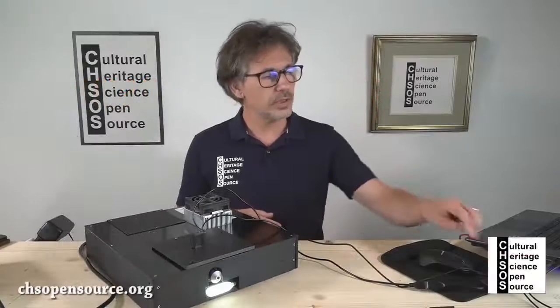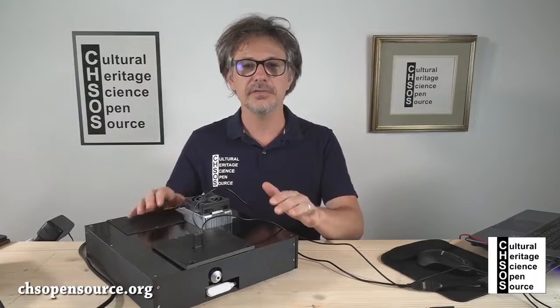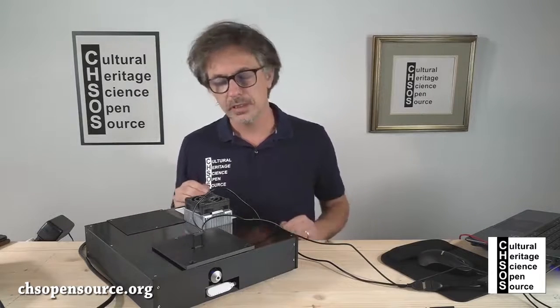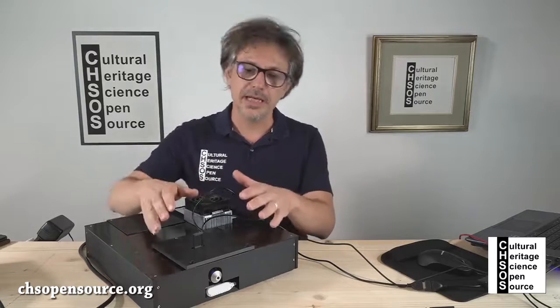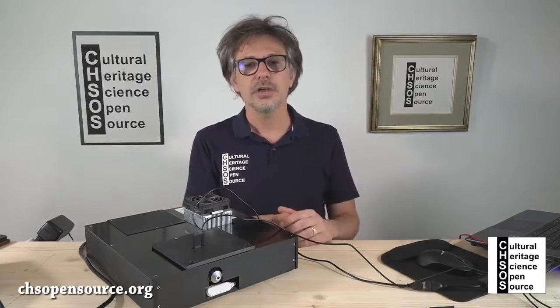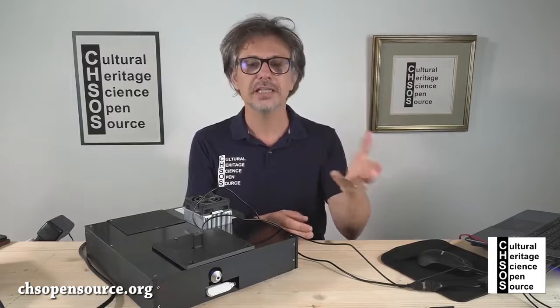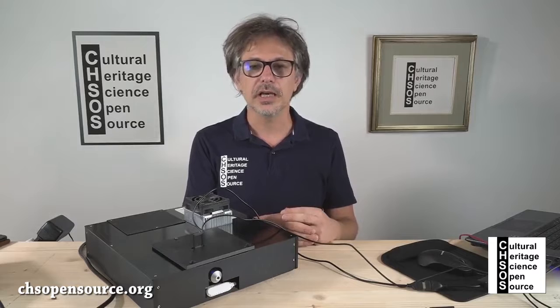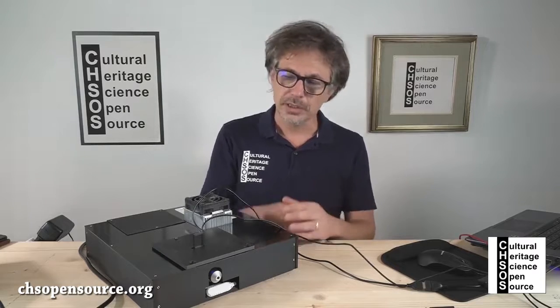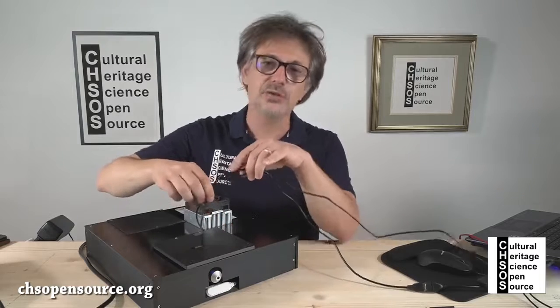In this class, we are going to discuss the camera that is inside the ElviRa spectroscopic system. Basically, there is a webcam that is connected to the objective of the system so that we can take a picture of the area that we are examining, or actually we can use this webcam to check the position on the sample. First of all, from the front of the system, there are two cables.